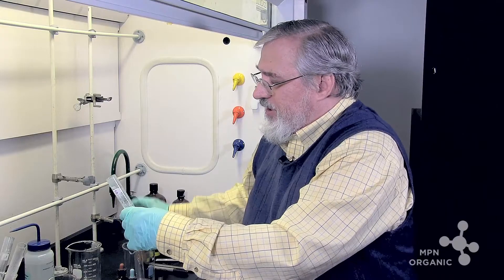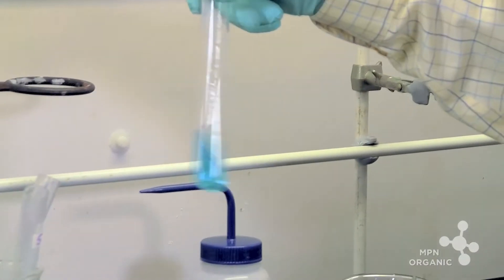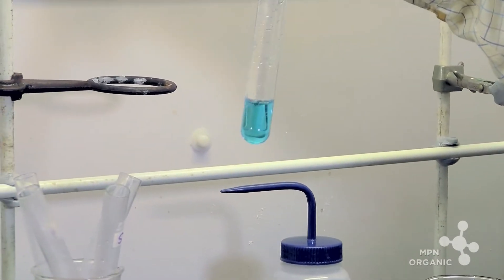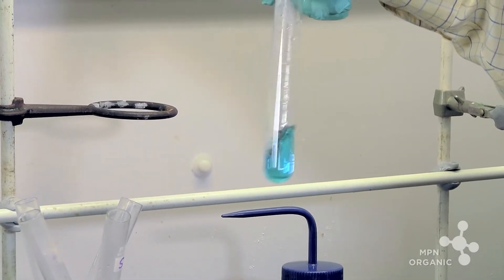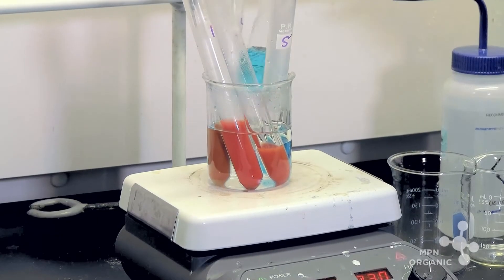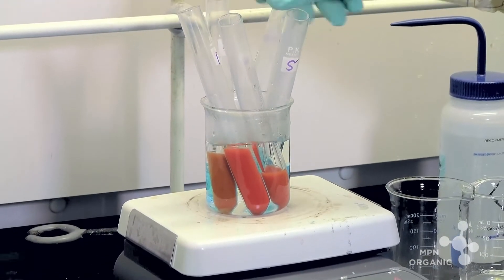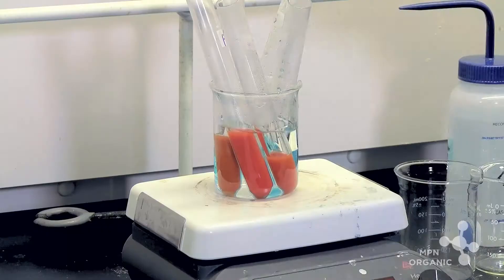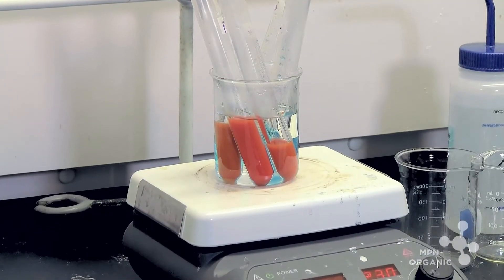So let's see what will happen if I add some Benedict's to this. Well, you can see what happens. The acid that I put in there is going to make the carbonate fizz a little bit. We'll see what happens.